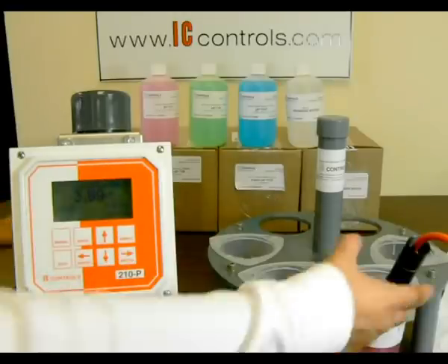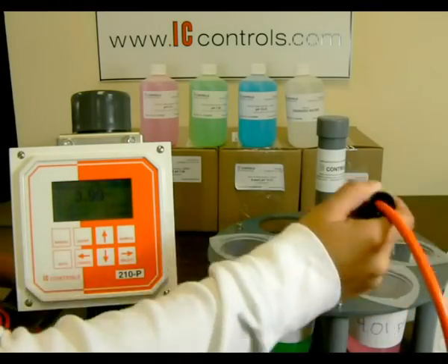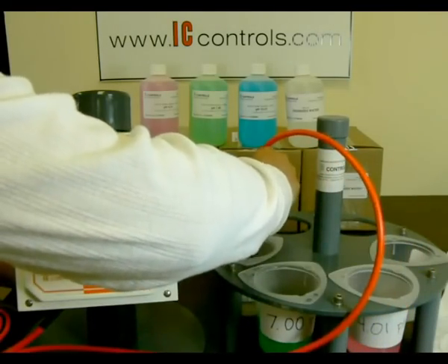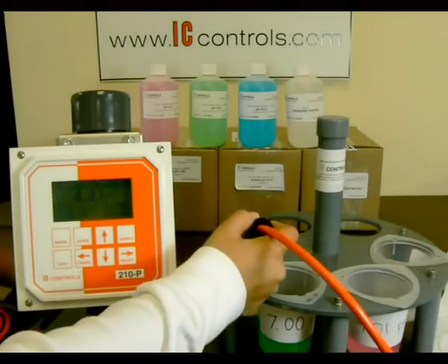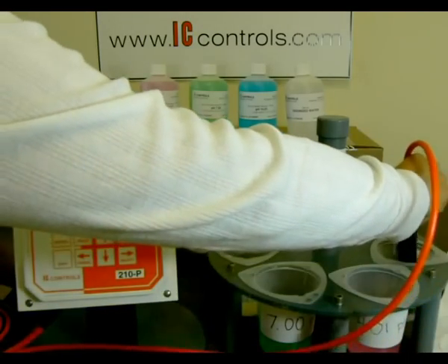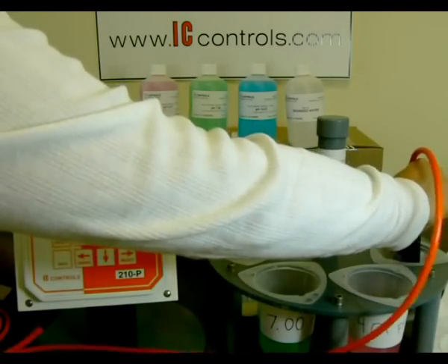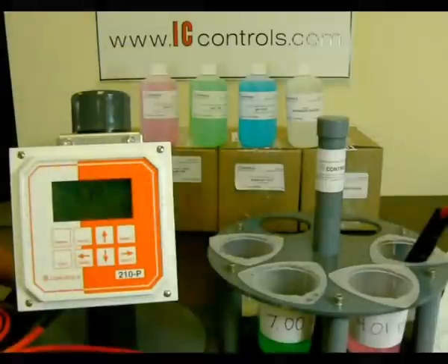Finally, rinse the sensor and tap off excess water. Insert the sensor in a test buffer. You should receive a reading equal to the buffer you are testing.